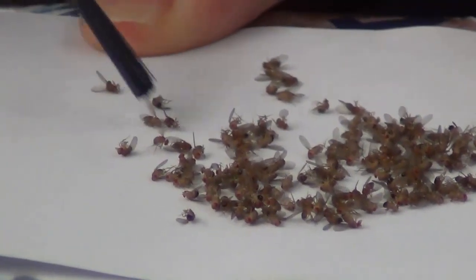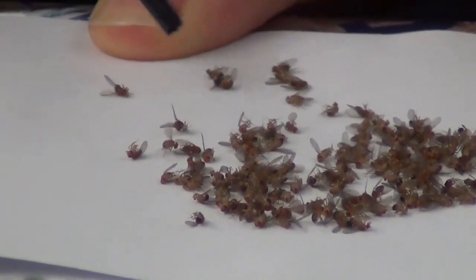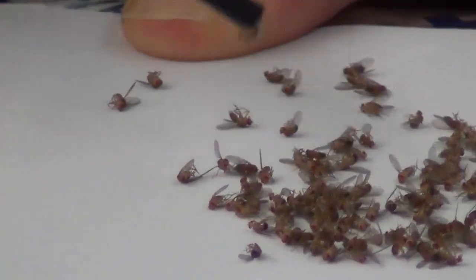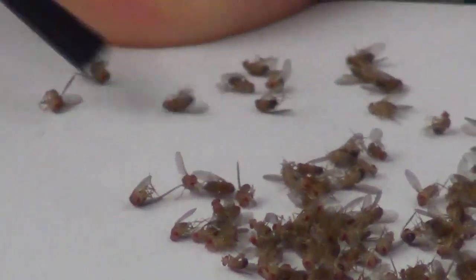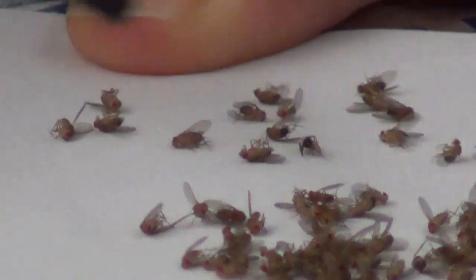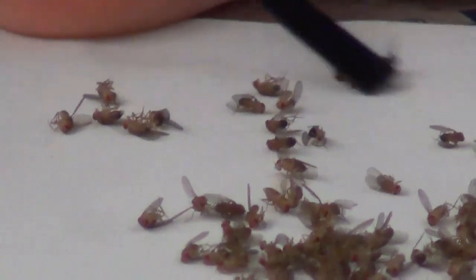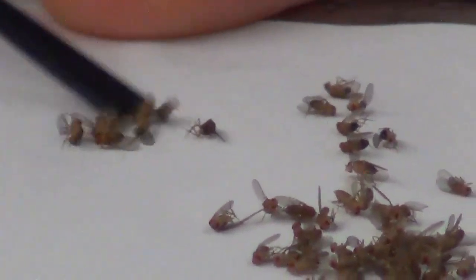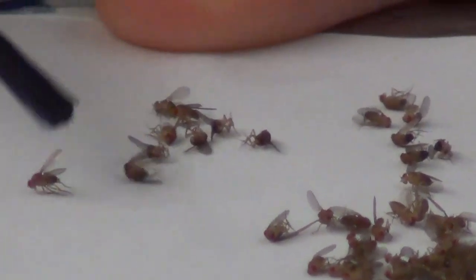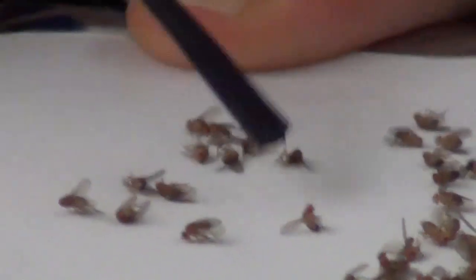So here's your opportunity to sort them, to look at them really carefully, and to identify males and females, maybe separate them into little piles with your brush. You should find with this F1 generation that they all have one particular trait, so it should be pretty easy to figure out what they all look like. So really all you need is about 6 males and about 6 females for each of your 2 culture tubes. So if they start to wake up on you, don't panic. Just get those 6 males and 6 females into each culture tube, and then you'll be fine.